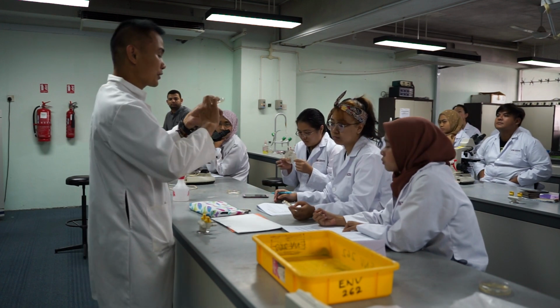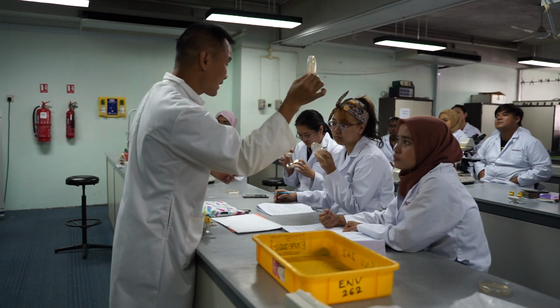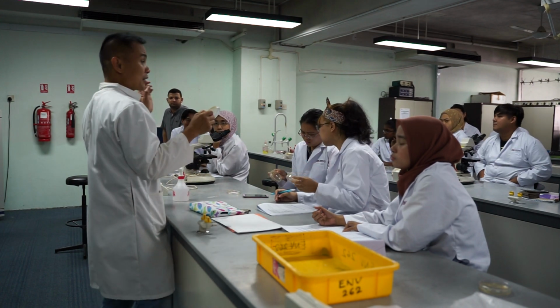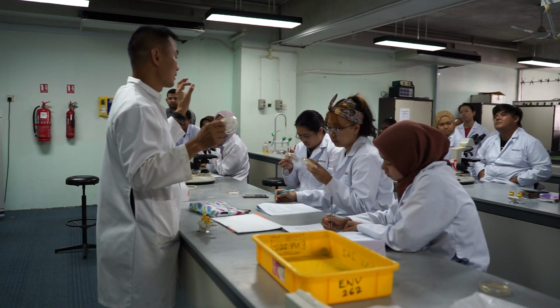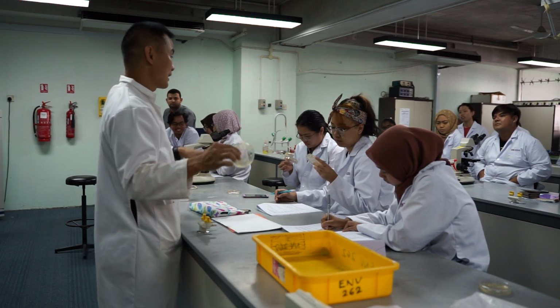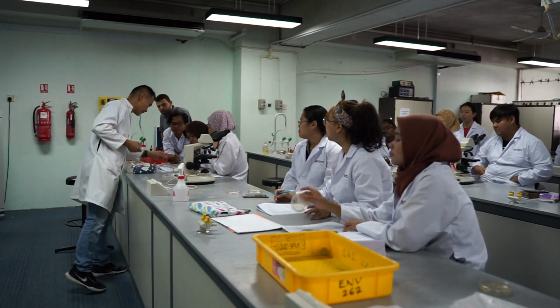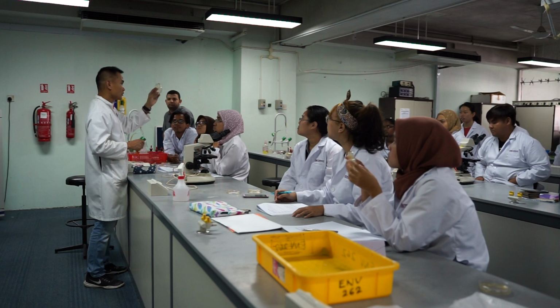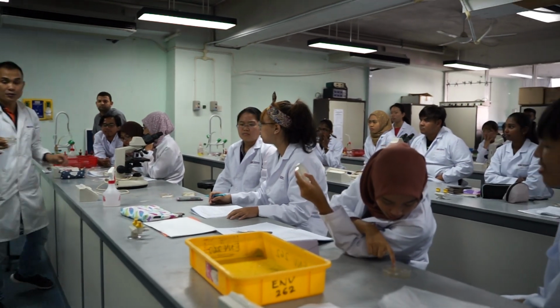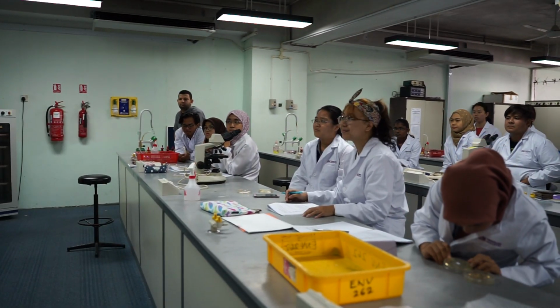Okay. So what you can do is you can actually get that one. Because they might be like a mixture. Can you see like different color there? In your one? Yes. Okay. So if you want to know what they are, you need to isolate them into a single species. If it is single species, next time you can just grow and regrow them. It's always going to be the same. But if it is a mixture, like is that a mixture? Yeah, like this one, you see white, green. So if you grow them again, they're going to combine. Okay. So how you do it? How you do the isolation.